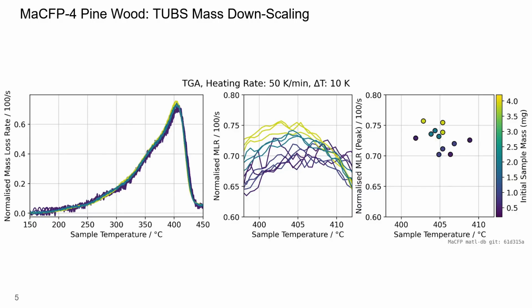At this stage, the peak positions were taken simply as a maximum value of each measured array. Because the data are noisy, the trend on the right is not yet very clear. To reduce the influence of the noise, we fitted a third-order polynomial locally around each peak. The transparent curves in the background are the original data. The solid curves show the fitted peak shapes. Once a peak position from the fitted polynomial is determined, a much clearer trend appears. Lower initial sample masses correspond to higher peak temperatures.